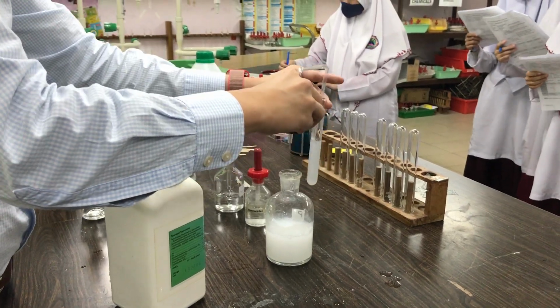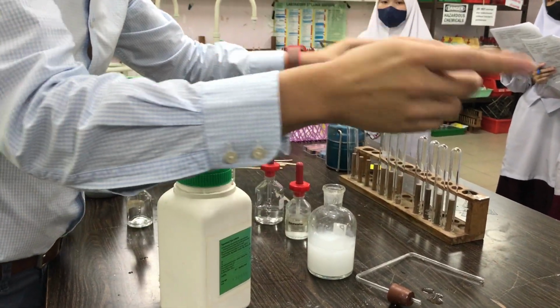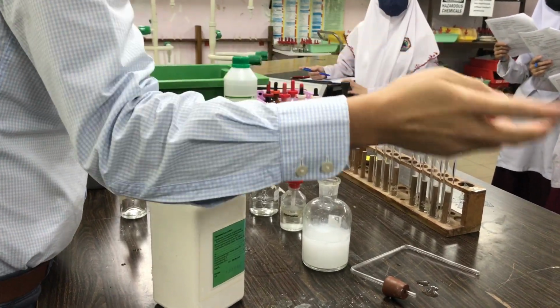Happy? Okay? Carbon dioxide, okay? You might want to wash your hand, but it's just lime water, it's fine. Just wash your hand, okay? Your hand got splashed earlier, right?